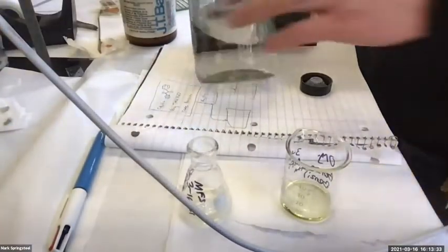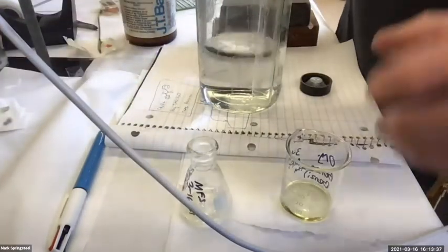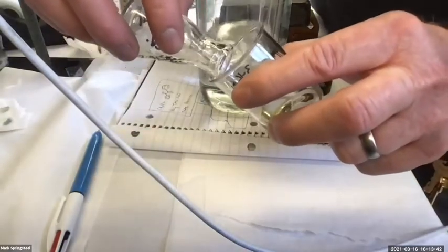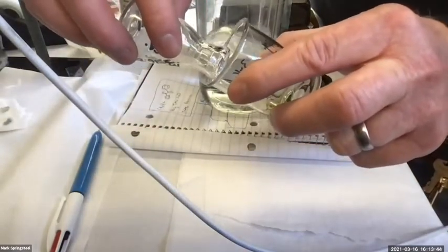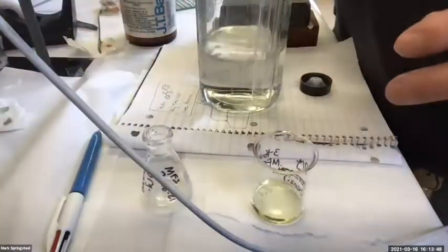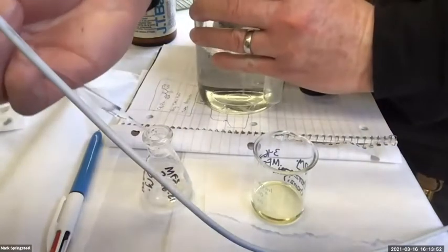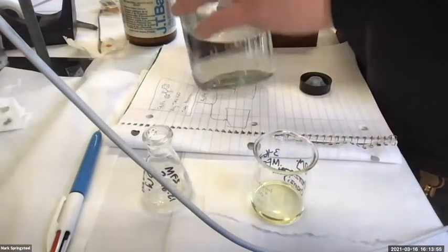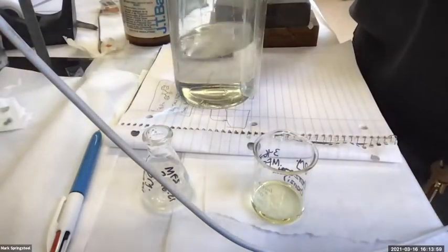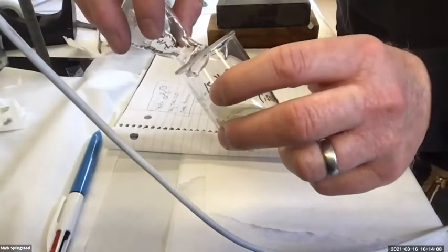sodium sulfate to rinse more of that methylene chloride off of it. And then I can swirl it around, decant again. Maybe do one more rinse. And I can tell the sodium sulfate after the first decant was a little yellow, but now it's not so yellow. Okay, got it. Decant again.